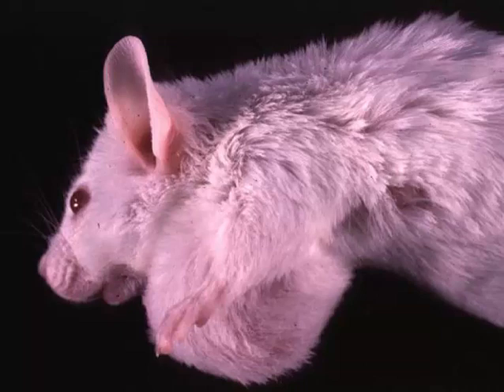These neoplasms are generally cystic and are considered by many to be low-grade malignancies based on cellular characteristics. But they tend not to metastasize, if ever, and they often will attain a rather large size before the animal is sacrificed. Salivary gland myoepithelioma. Think of it in white female mice.